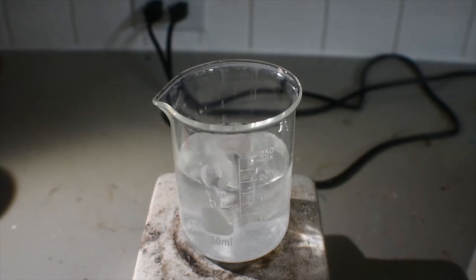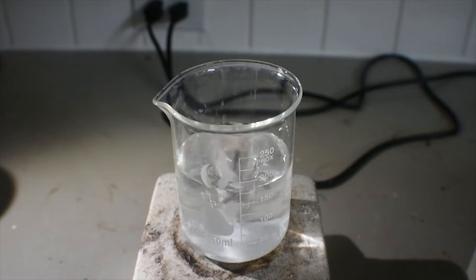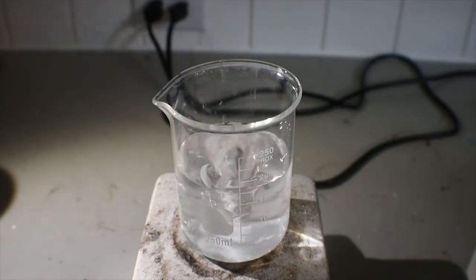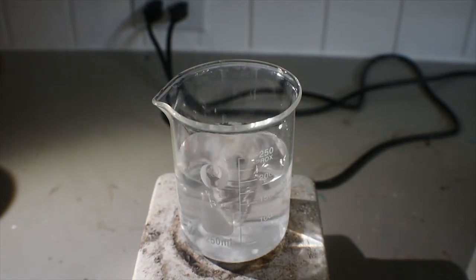As you can see, it dissolves fairly quickly, with only the larger lumps being left undissolved. These should go into dissolution fairly quickly, as potassium oxalate is pretty soluble in water.